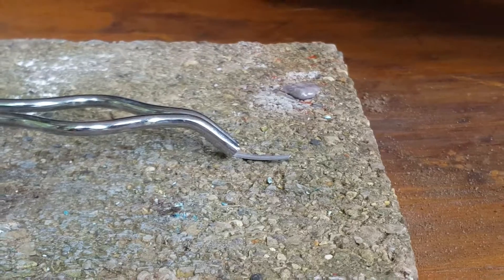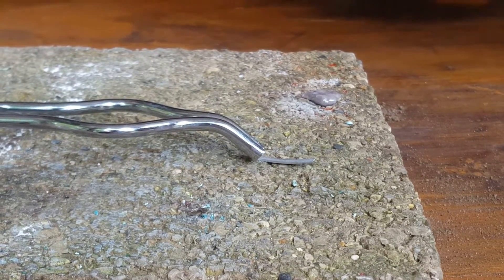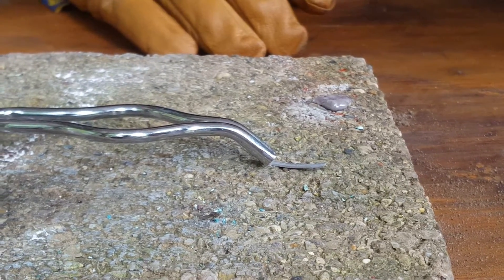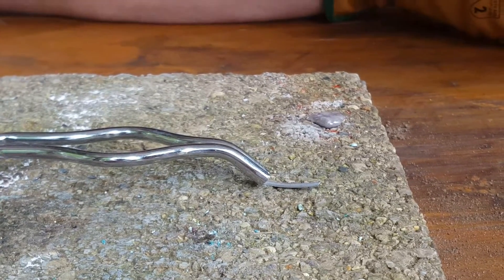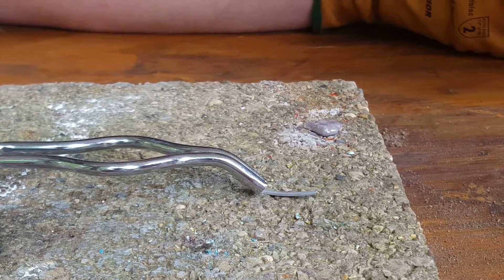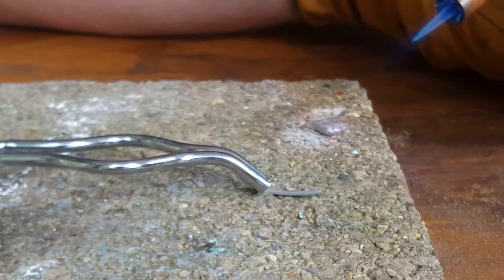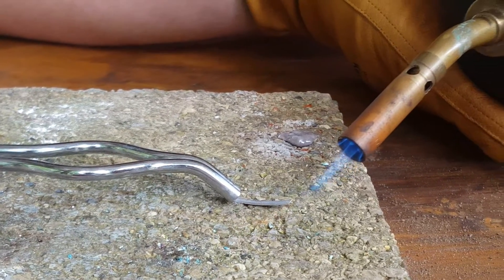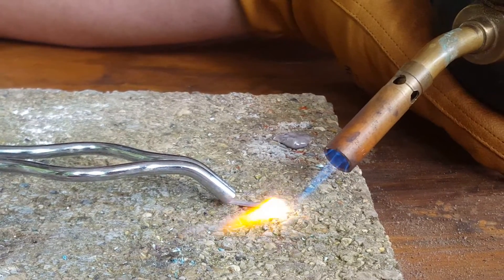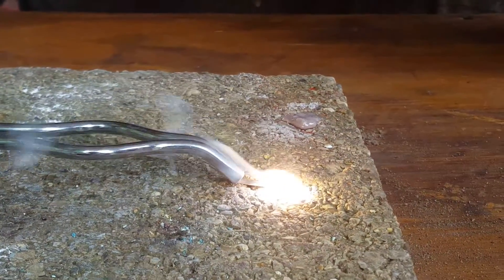Here we have a piece of magnesium metal. It's pretty light, so I'm having it held down with these tongs. Magnesium is one of the only very flammable metals. As you can see, it burns with a bright white flame.